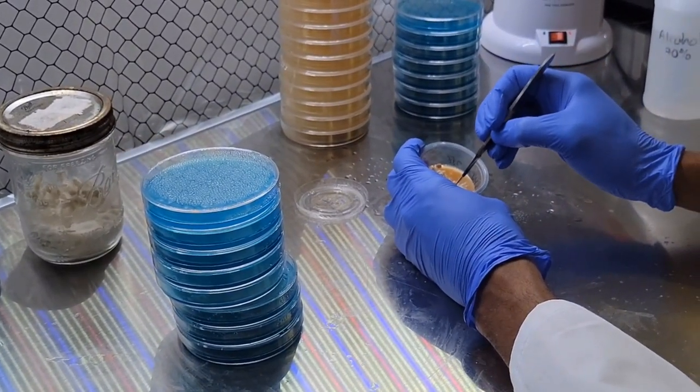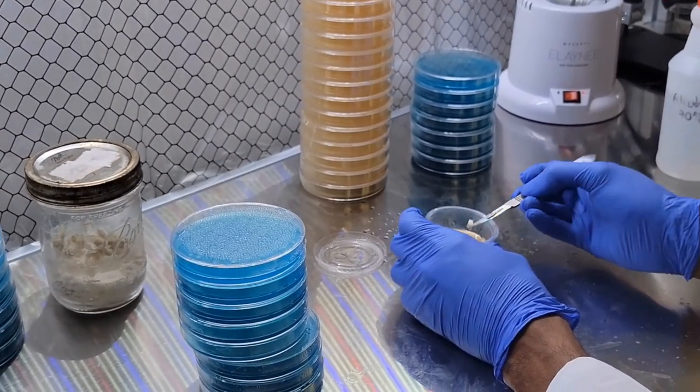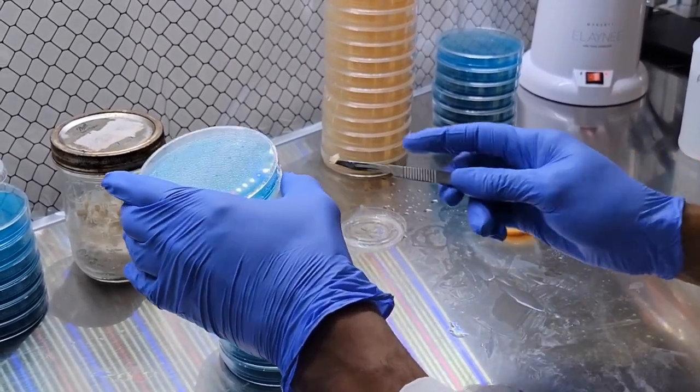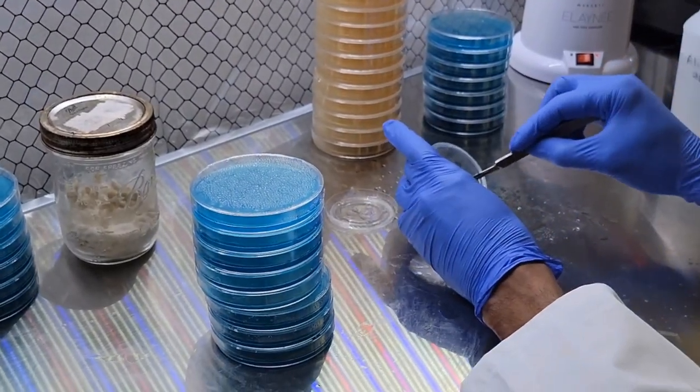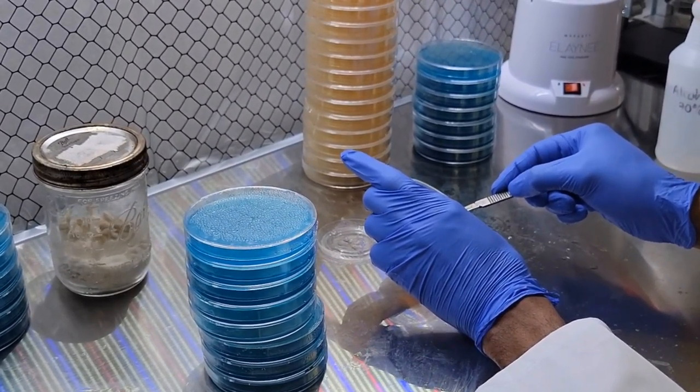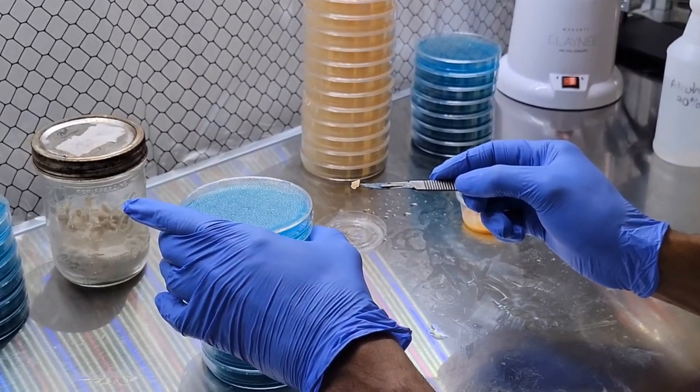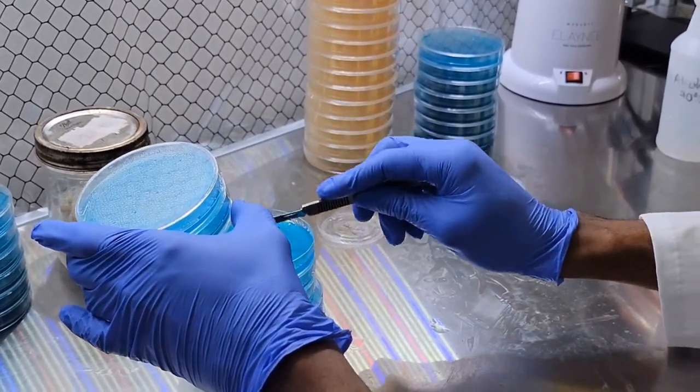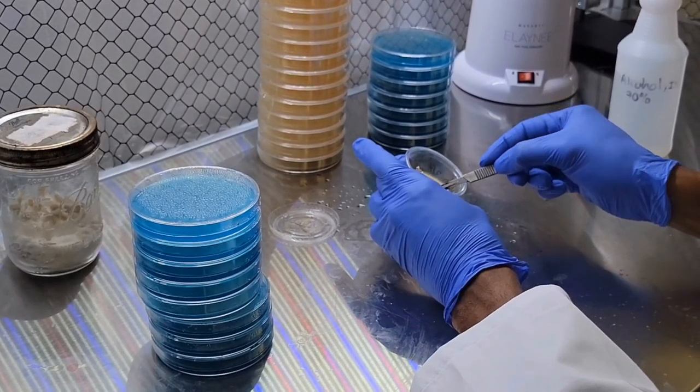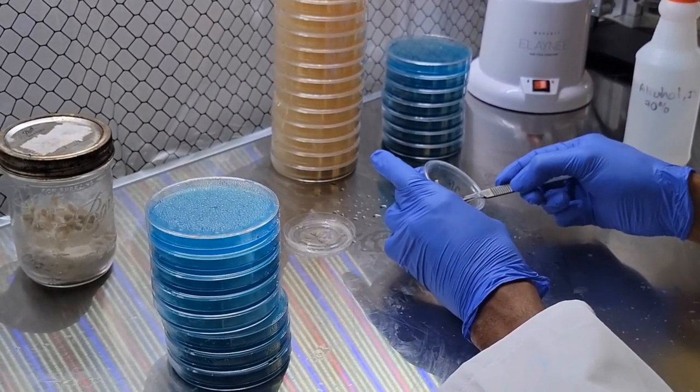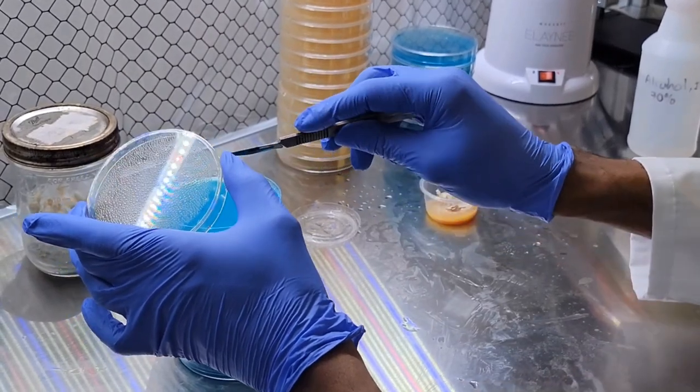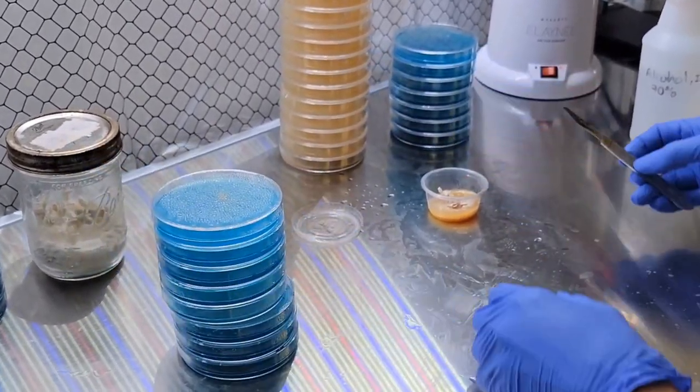And actually what we'll do—these last few, this is really cool to watch—we're gonna take a couple of samples to the same dish and have them combine together. There we go.